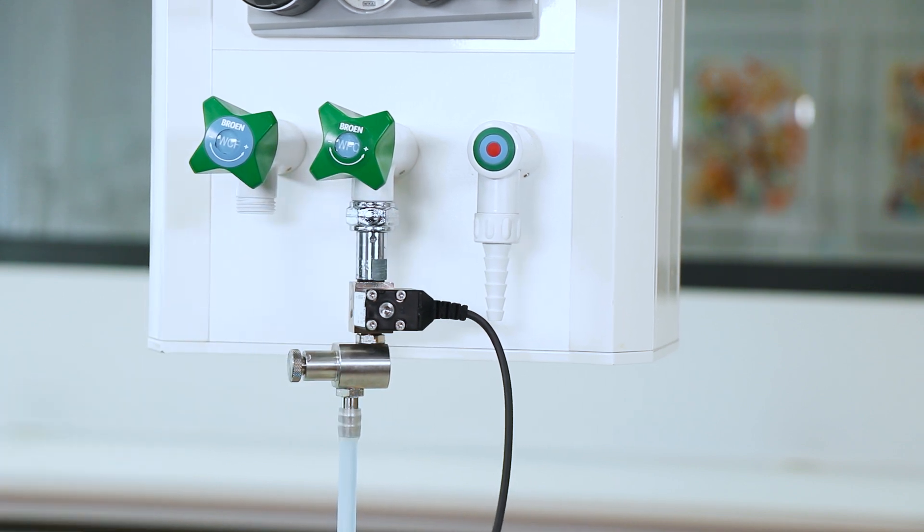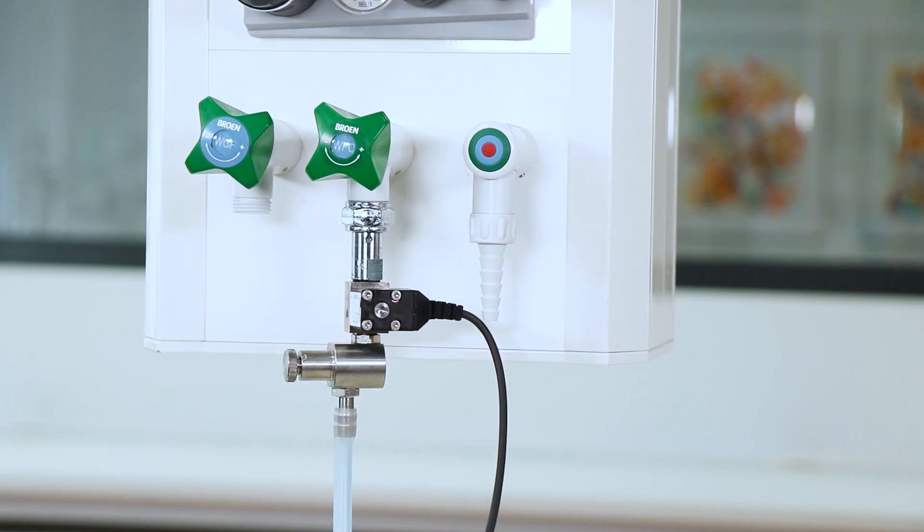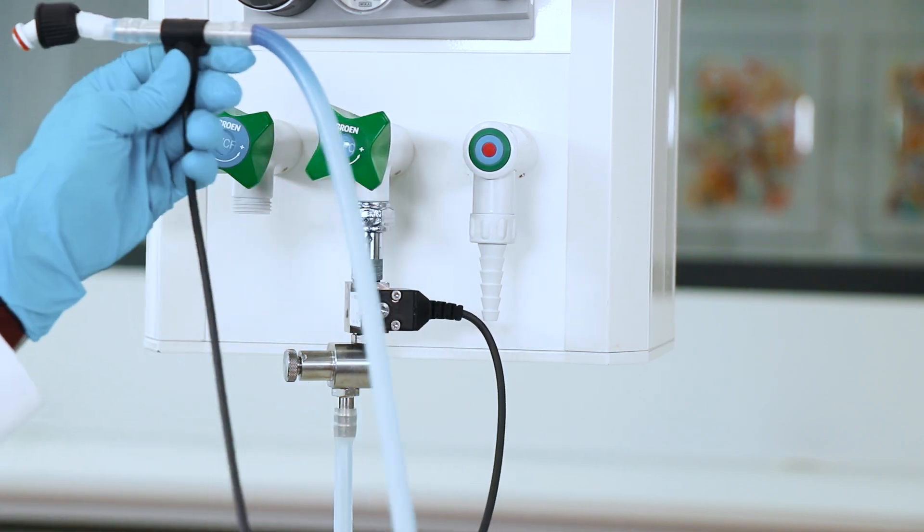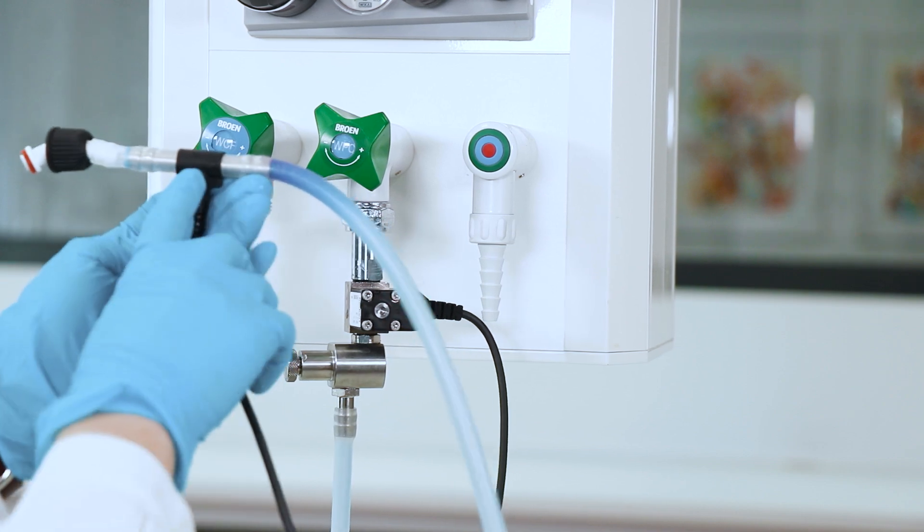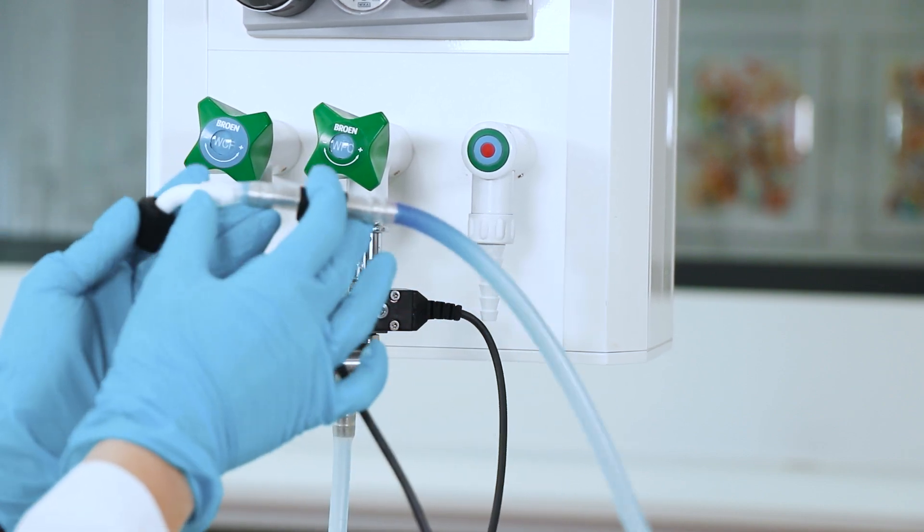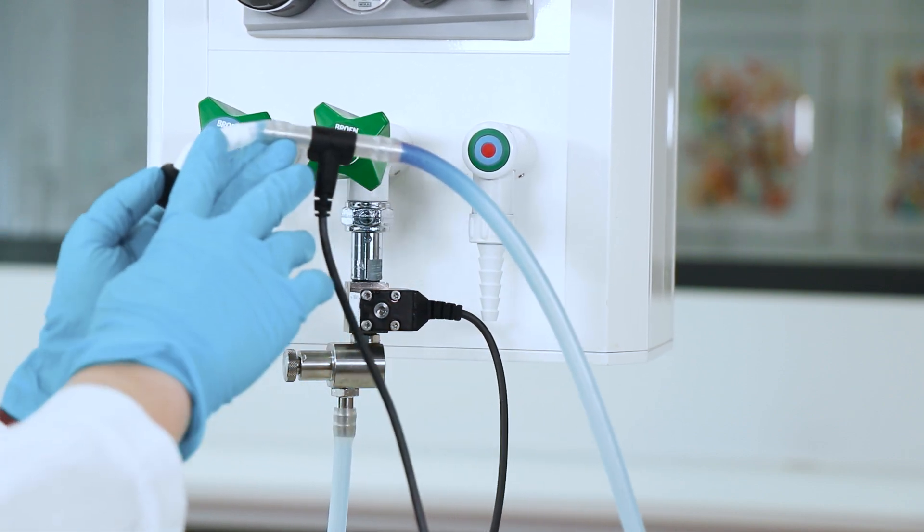And then this piece, I already prepared it. You actually connect the cooling water sensor to here. And then you take the five centimeter piece and connect it to the hose nipple.